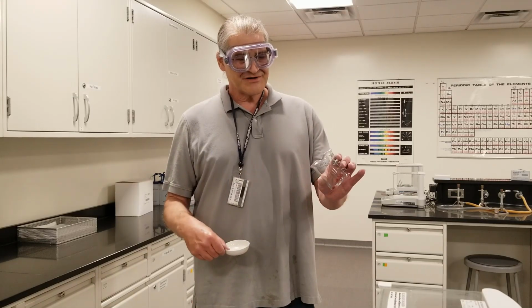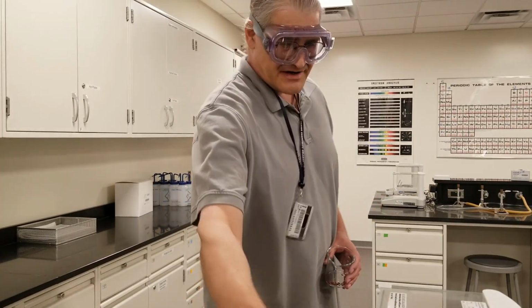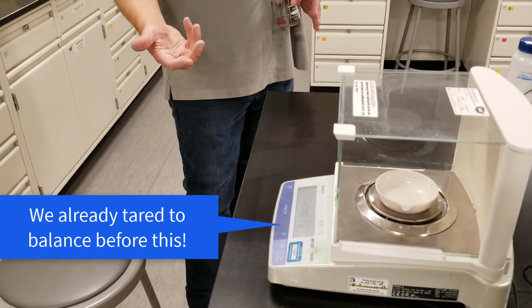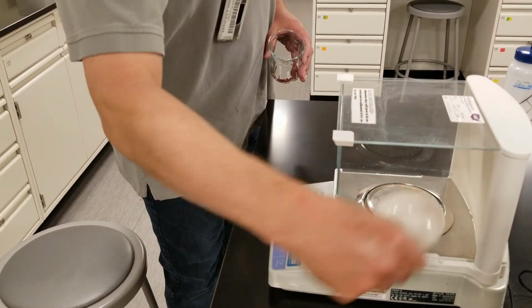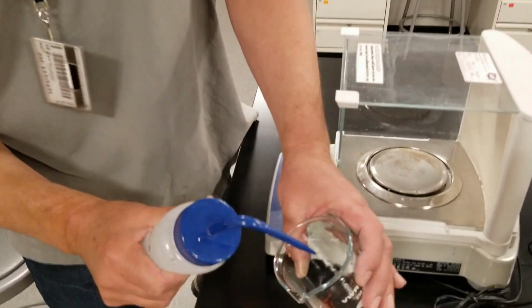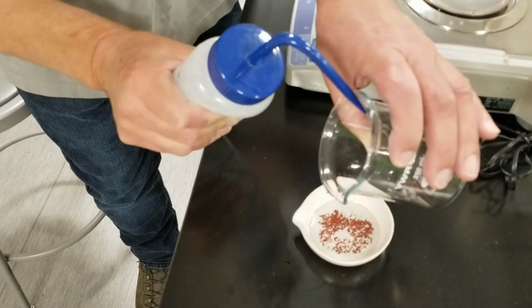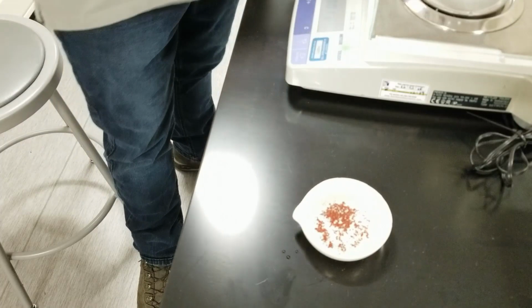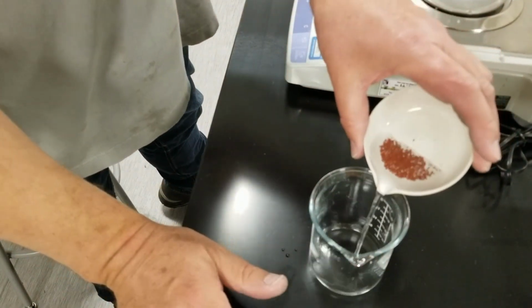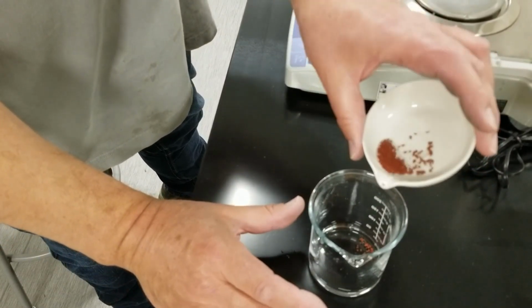Okay, to figure out how much copper we've recovered, we're going to start with an empty evaporating dish and weigh it. So we'll know the mass of the empty evaporating dish. Then we will transfer our copper powder into the dish. I'll transfer it by simply washing it in there. Here's our copper powder. We'll decant off the water. Oops, lost a little copper there.